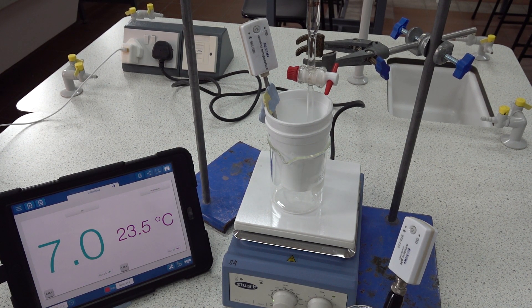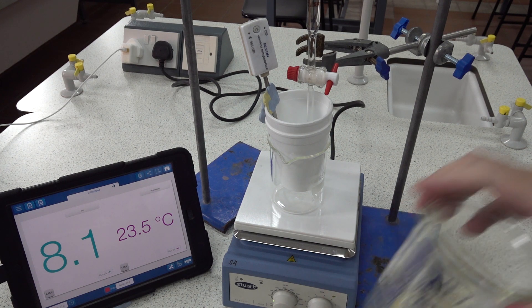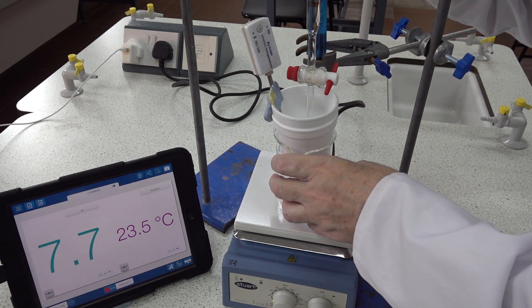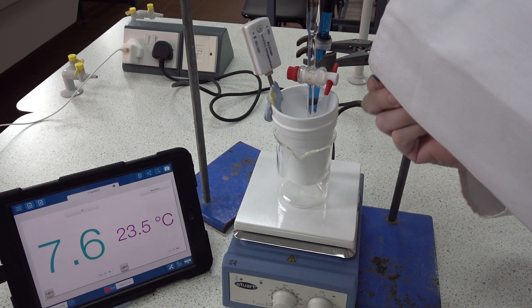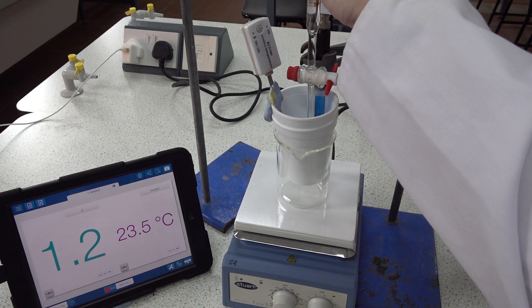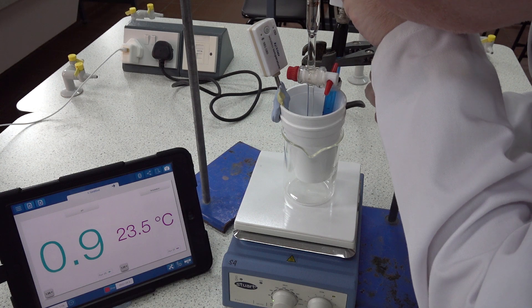There's the calibration reading at the start — temperature is reading 23.5°C and the pH probe is in a pH 7 buffer. Let's rinse the probe and now we need to position it into the reaction vessel, clamping gently, so that we can lower it down into the acid, which we've now done — and you can probably see that by the pH reading.